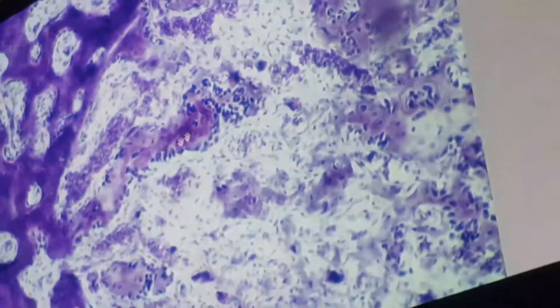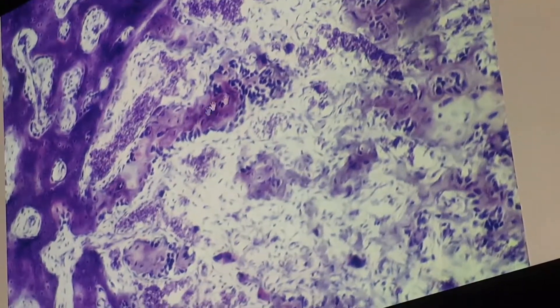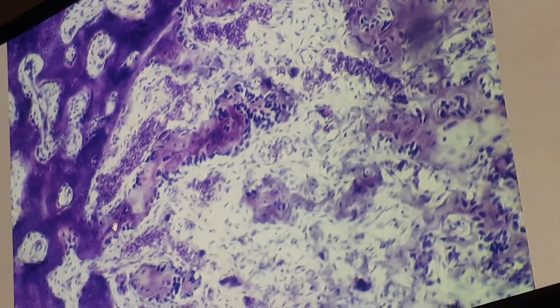The fourth zone is the calcification zone, where the thin septa of the matrix become calcified with the death of chondrocytes. The last zone is the ossification zone, where endochondral bone tissue appears, with osteoprogenitor cells forming osteoblasts and other cells.